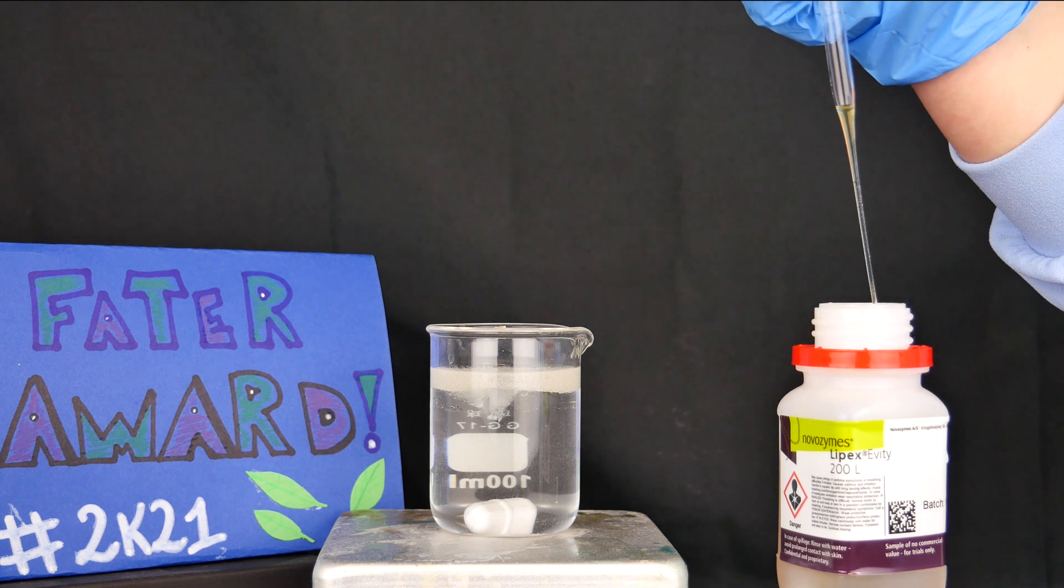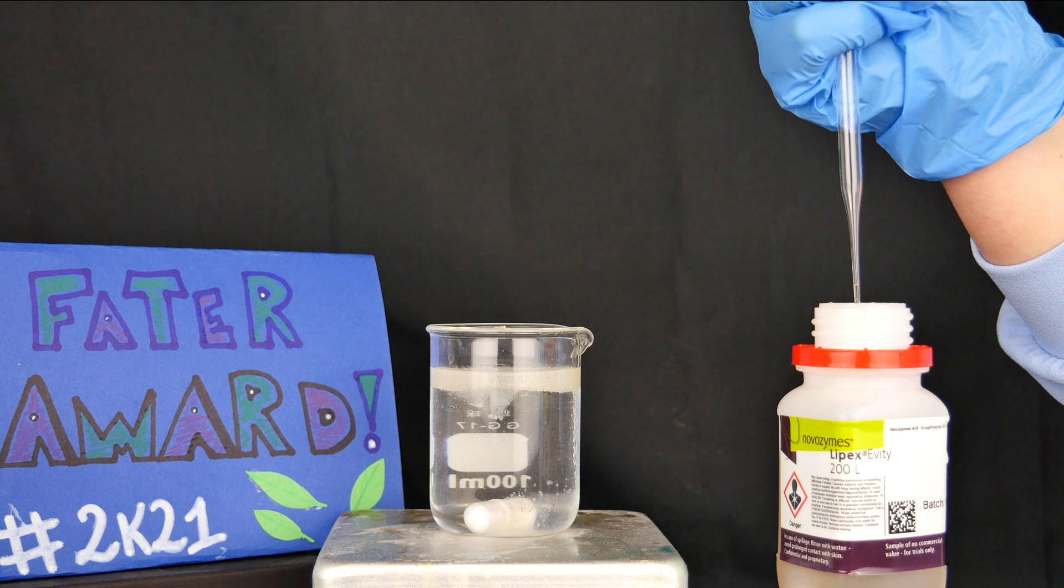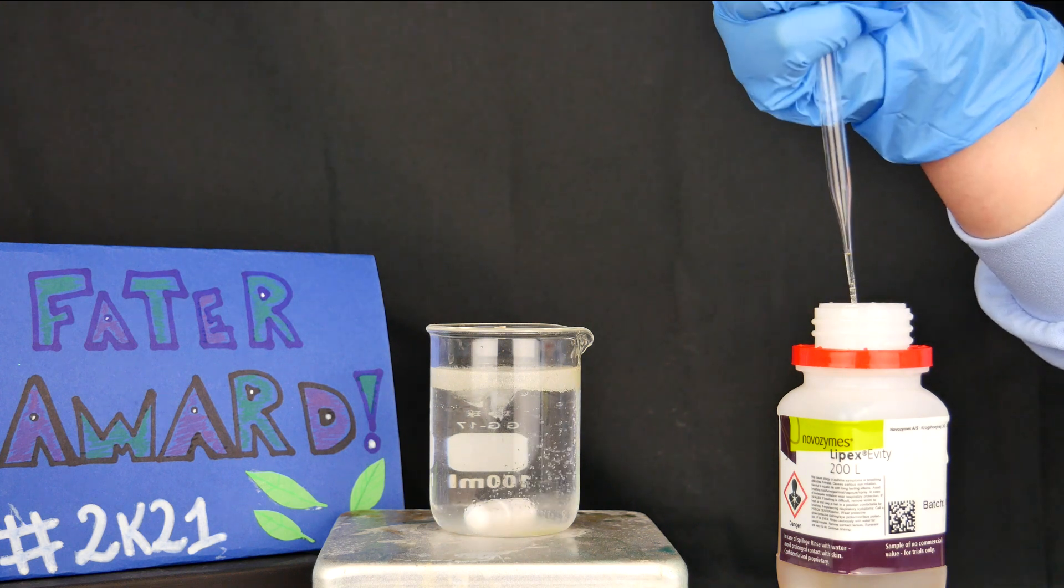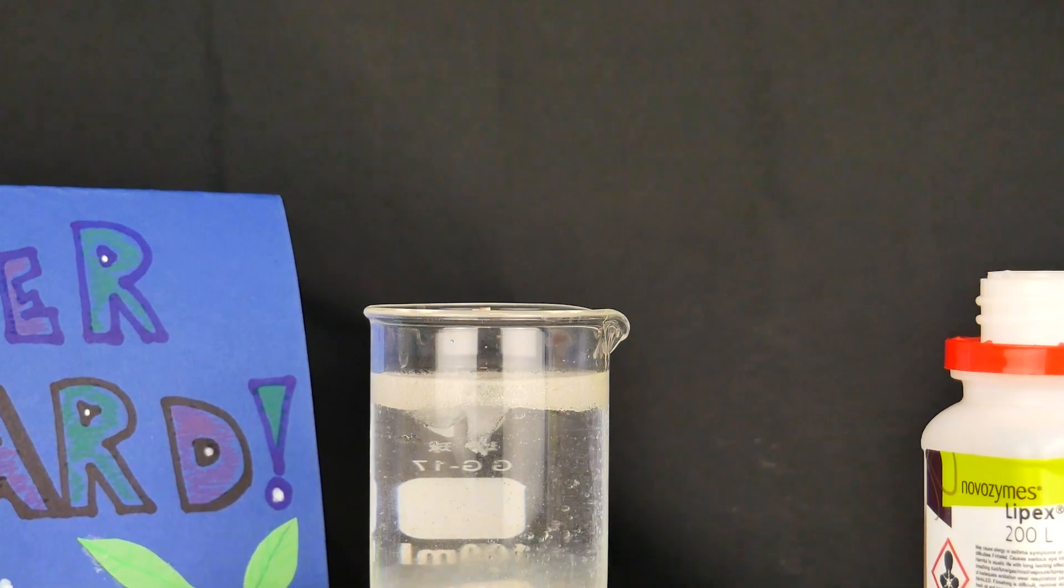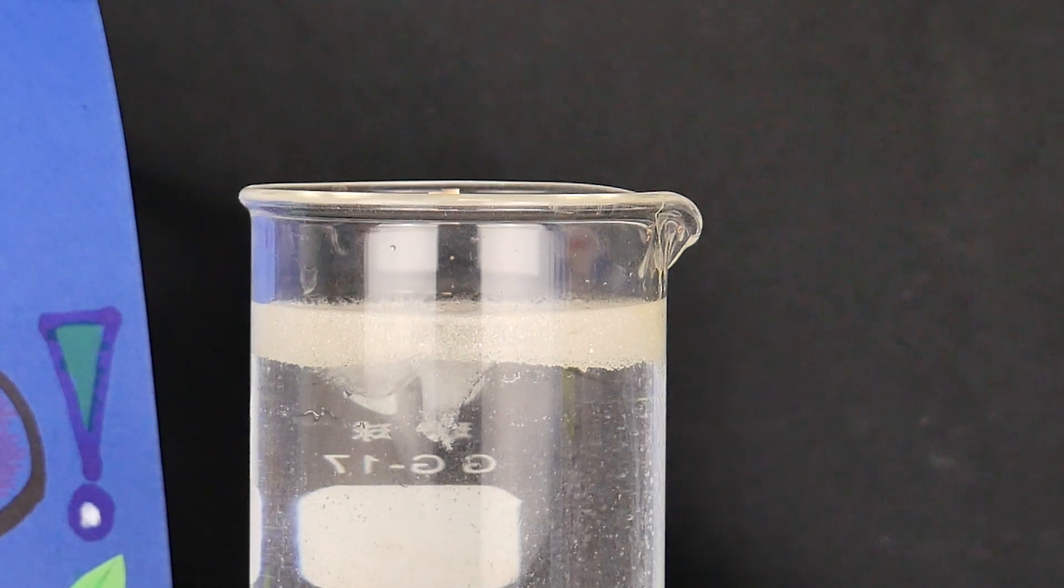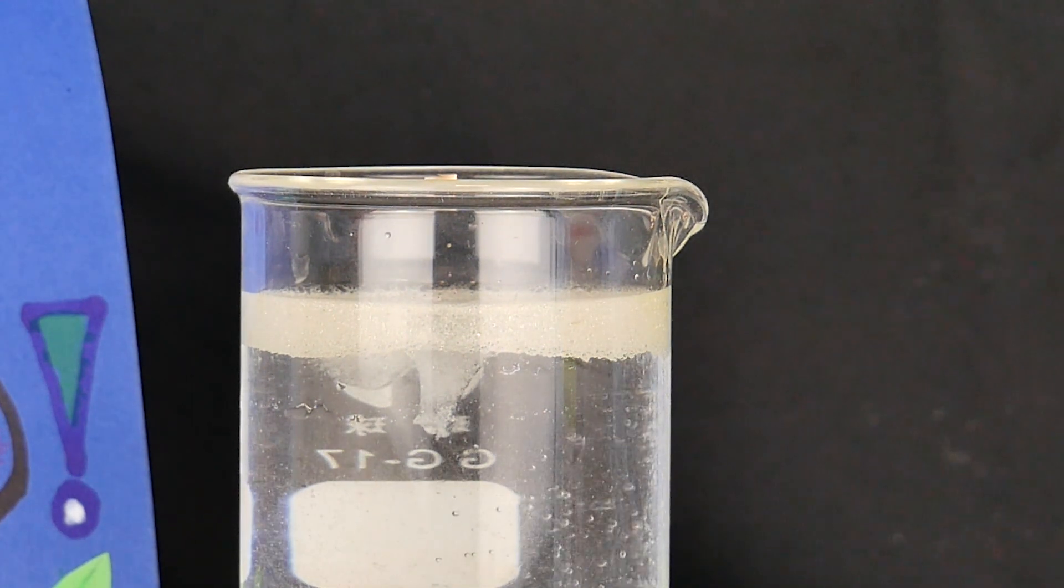We then add the enzyme to the mixture and we immediately notice an instant degradation of the oil, consisting mainly in triglycerides which are hydrolyzed by the enzyme and converted in fatty acids and glycerol.